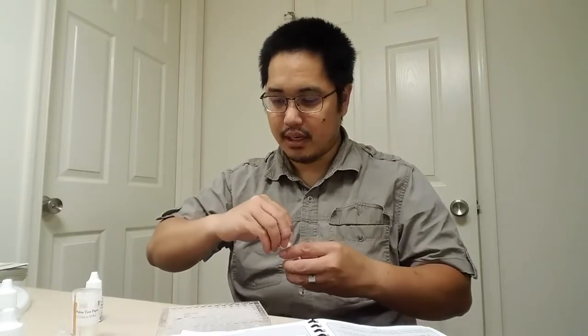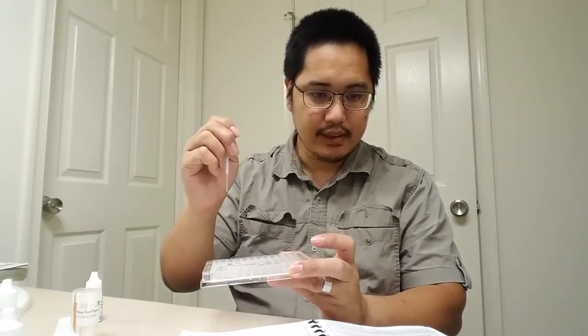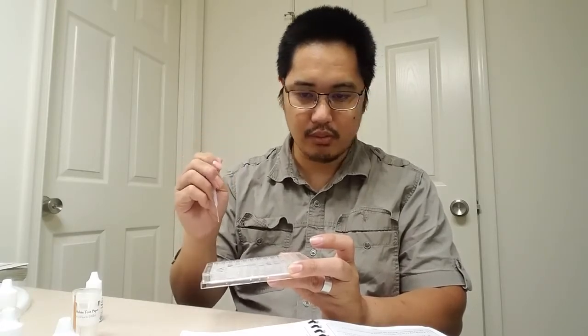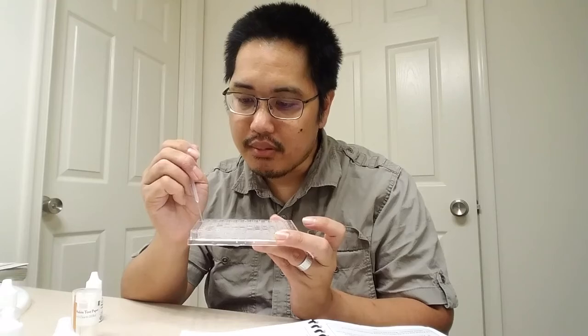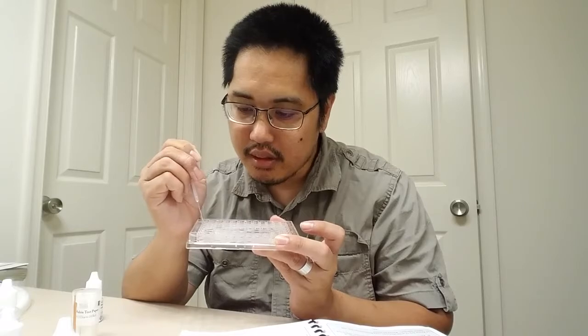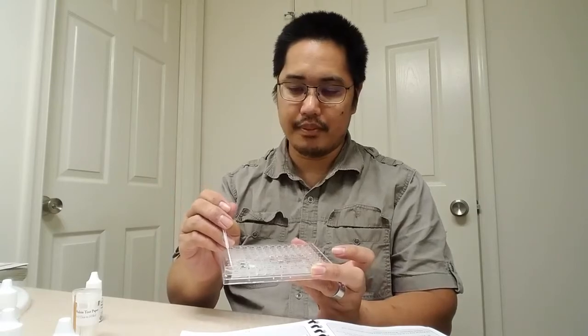And then I'm going to use that as a container for my sodium hydroxide, because what they want me to do is to use this mini pipette and fill up this thing over here. So I need to put 1 drop from the mini pipette into the water in each well of this column. So I'm going to put it into 12. I'm going to take out the pure sodium hydroxide and put 1 drop from there, and F. Perfect. So I did 1 drop from A12 to F12.